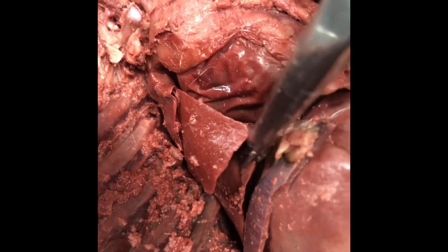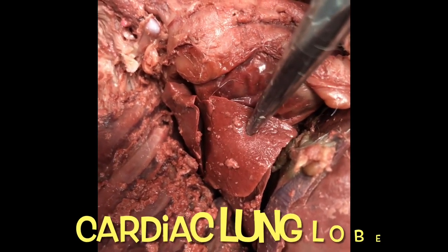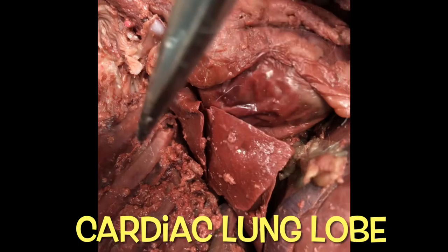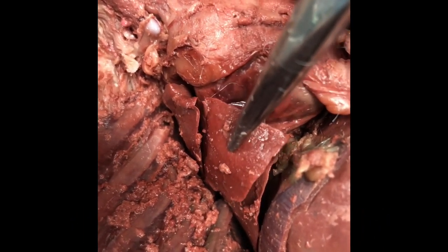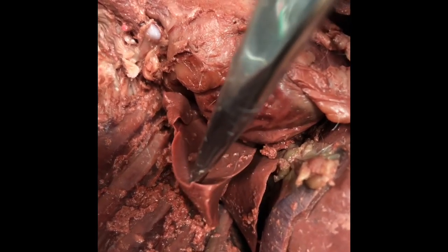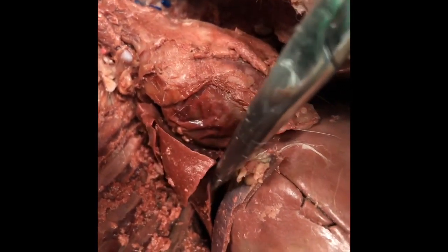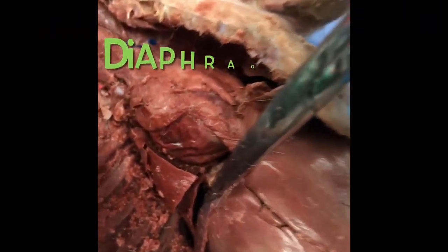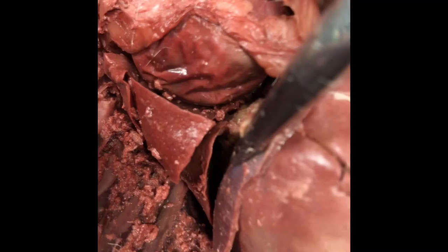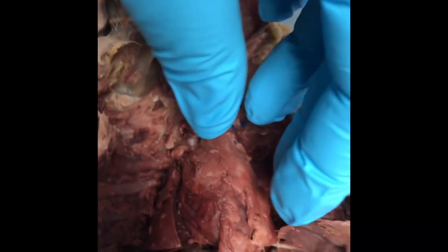Right underneath the diaphragmatic lung lobe is the diaphragm itself. So again, the cardiac is there and the apical is at the top. A, C, D — apical, cardiac, diaphragmatic — sitting right on top of the diaphragm. The diaphragm is the thin muscle that separates the thoracic cavity from the abdominal cavity.